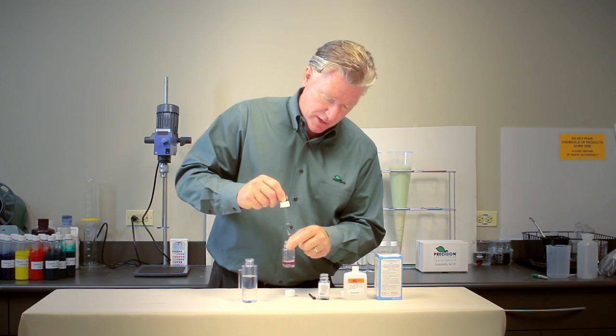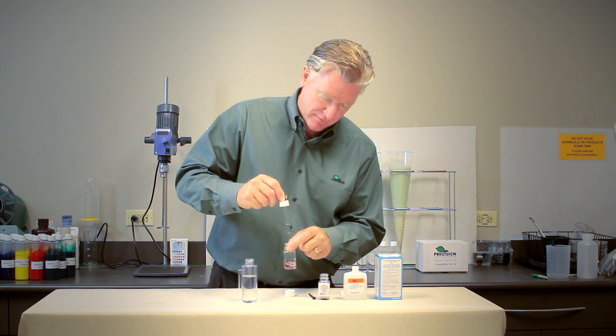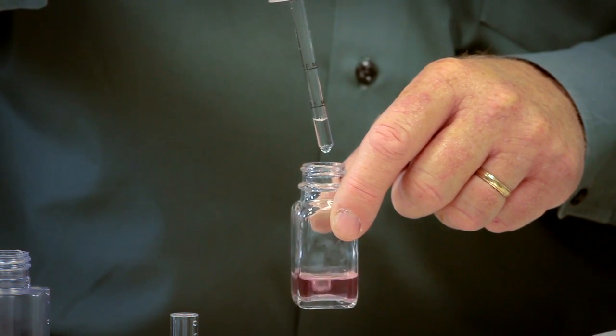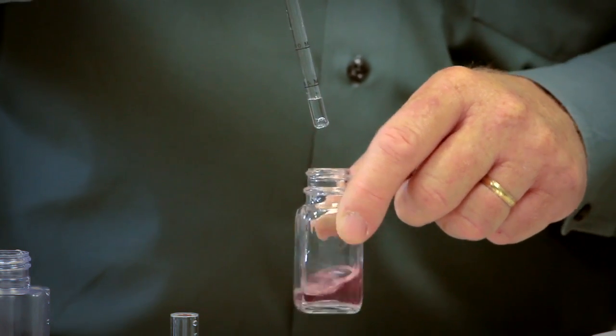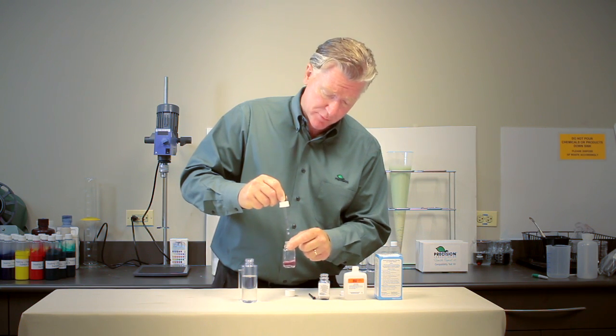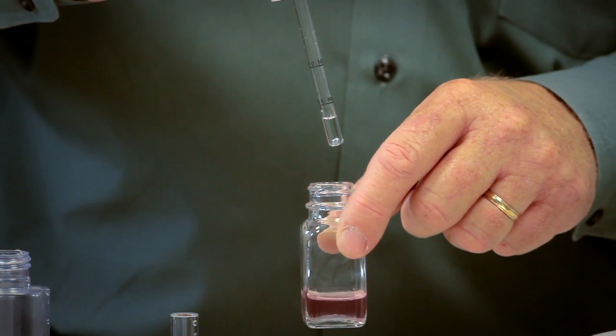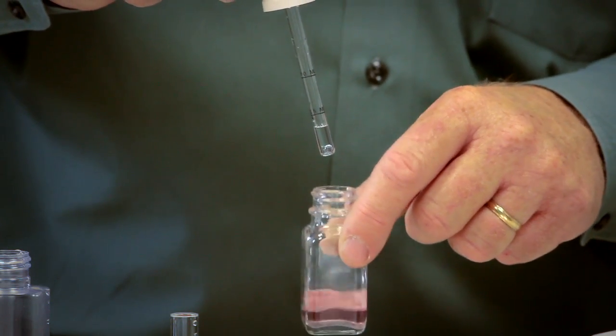2, 3, 4, 5, 6, 7, 8, 9, 10. Still no color change so we had 10 drops we'd be up to 170 parts per million which is considered hard. Generally speaking we think anything over 80 parts per million is being problematic for glyphosate.